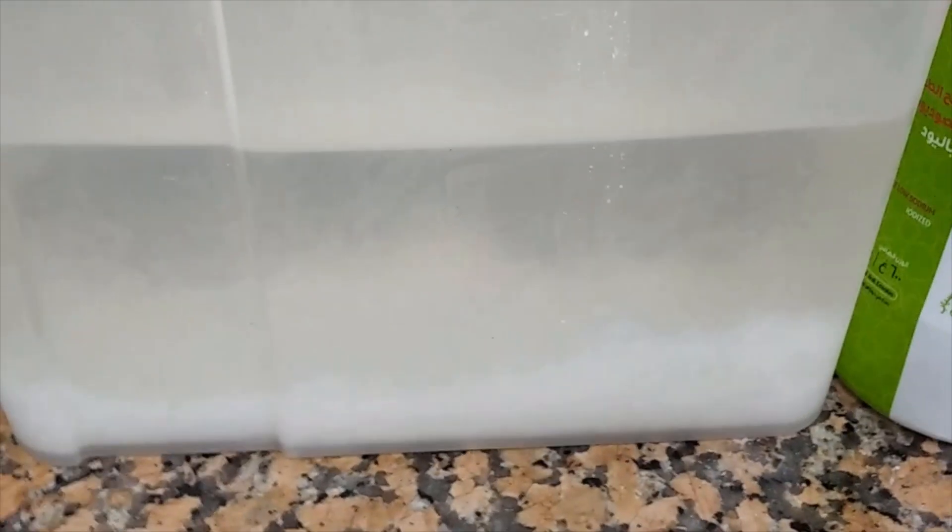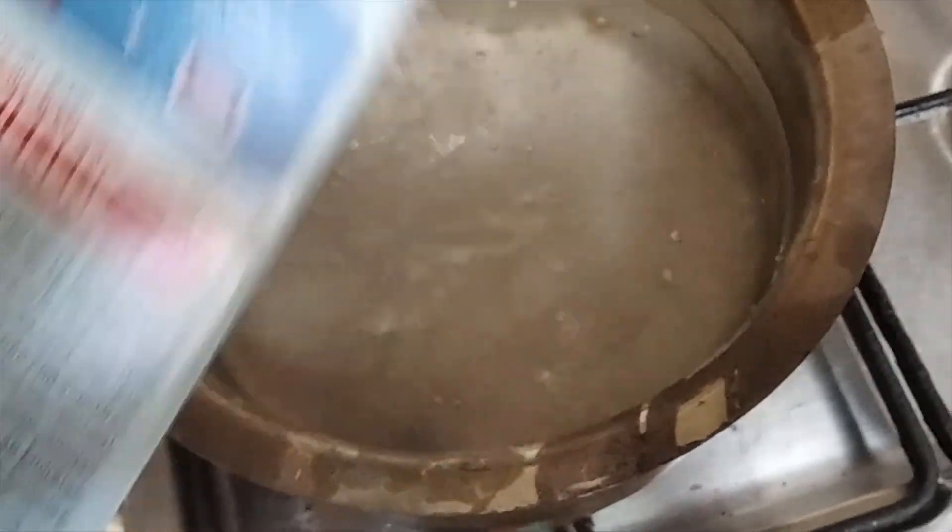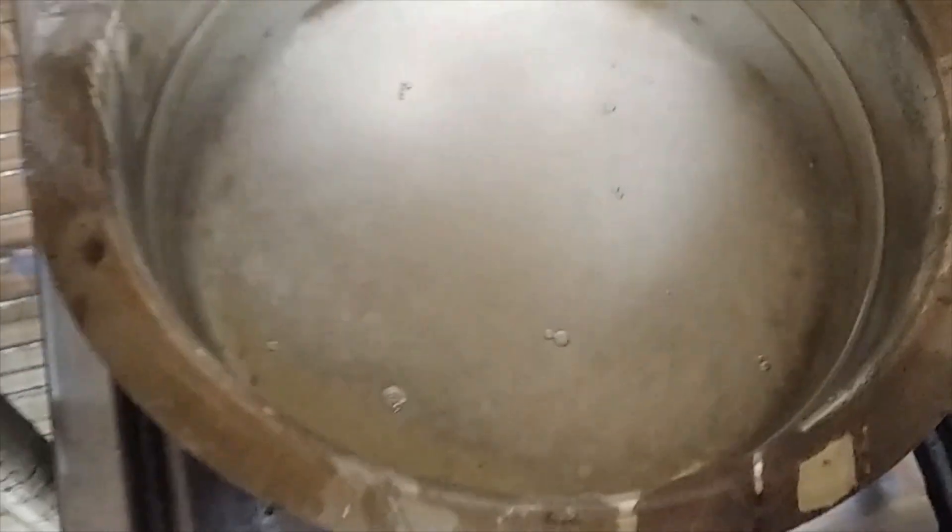Now you're probably wondering what we're going to do. We've got a lot of potassium chloride, but I'm pretty sure this isn't all of it — of course it isn't. So what we're going to do now is collect this liquid and add salt. When we add sodium chloride to this liquid, the solubility curve of sodium chloride is flat, so it doesn't change much, and we'll be able to push out all the potassium ions from the solution theoretically. I don't expect theoretical yield — something like 80% is probably passing. Next step: pour some regular sea salt into this. Around that much should be good enough.